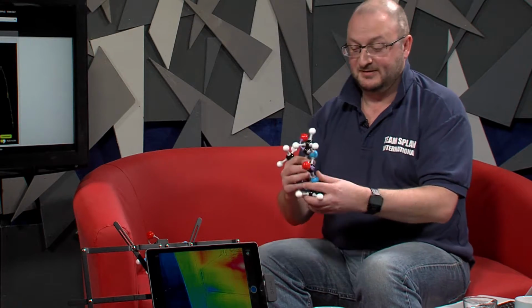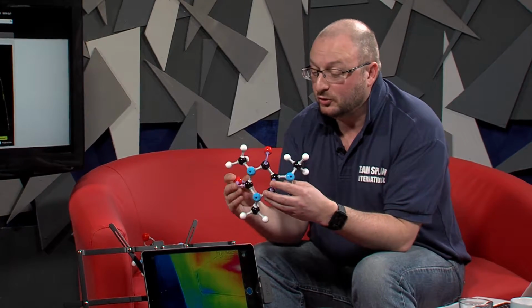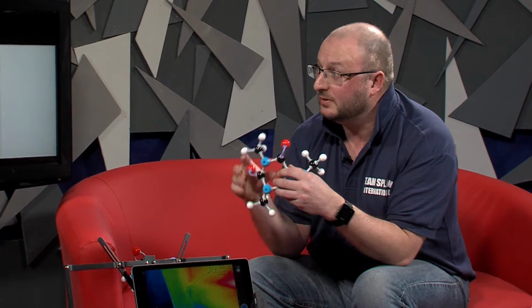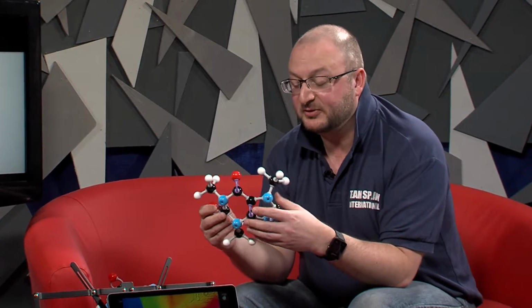Well, it has lots of applications, as you said, with the ones we've discussed. But I'm a chemist by training, and we use this for analysing chemical compounds. Right. So effectively, each compound, and I have some... I wondered what the molecule things were. I have some models here. This is a model of caffeine. Each compound will absorb infrared energy differently. Okay. And this is where our spectrophotometer comes in.